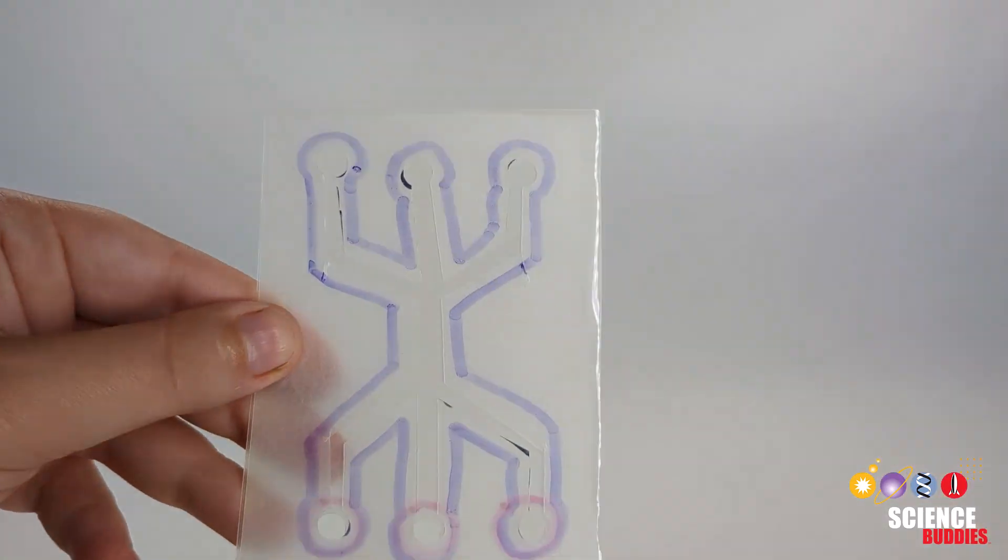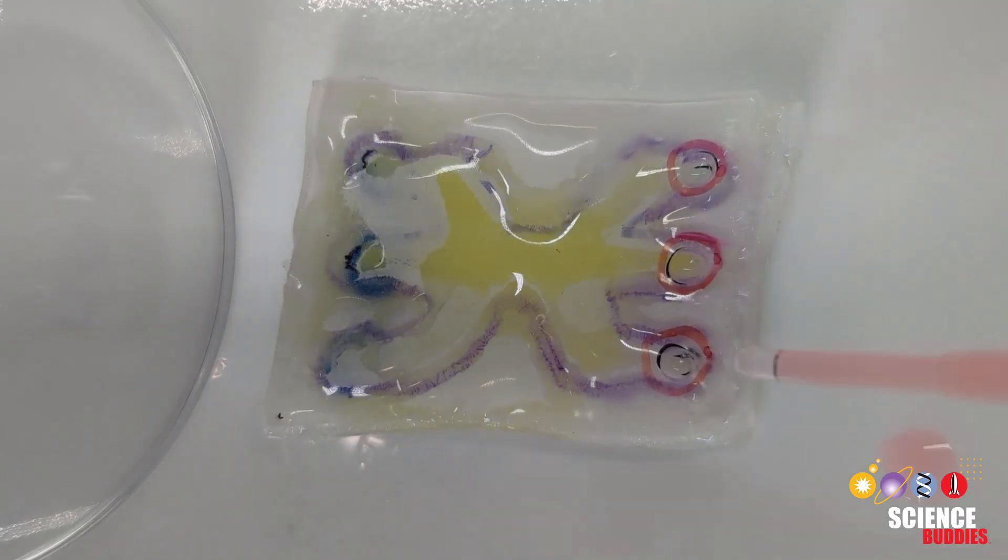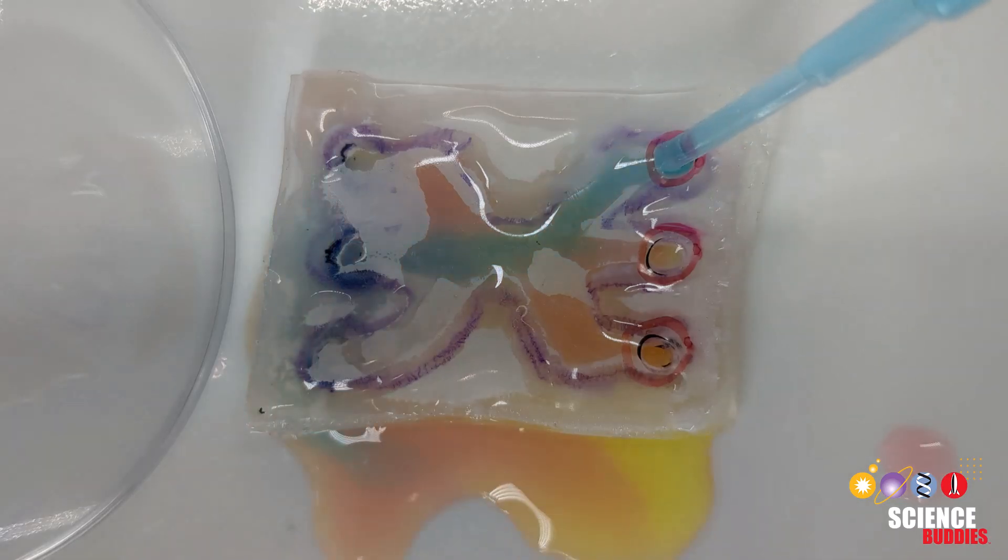Hey, this is Dr. Ohl from Science Buddies. In this bioengineering project, you will make your own microfluidic device. Microfluidic devices are used in many different fields, from engineering to biomedicine.